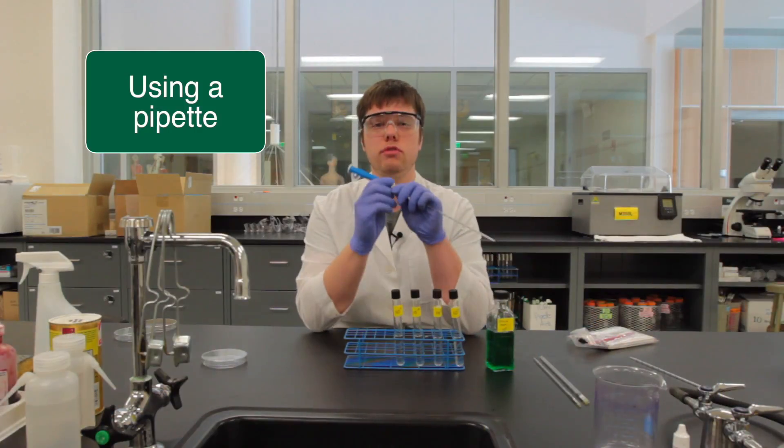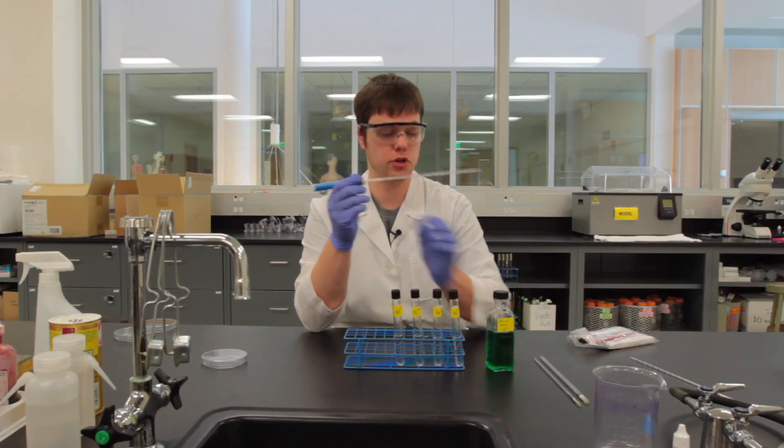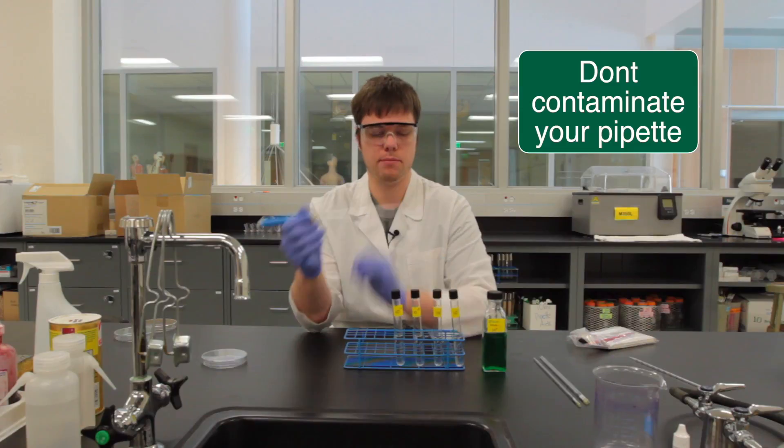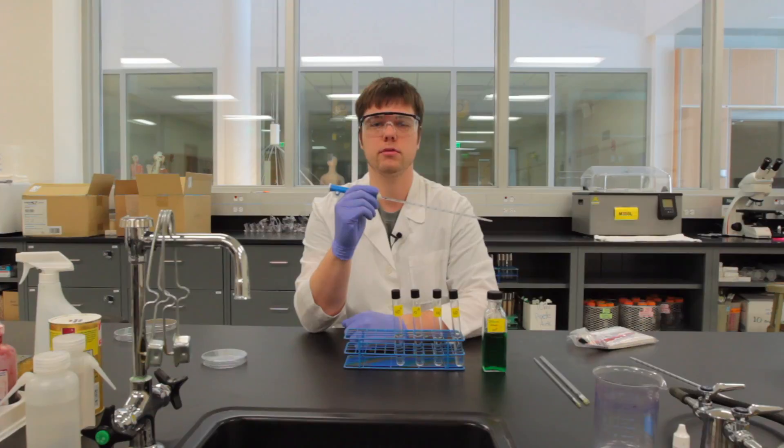We want to make sure that whenever we're using our pipettes and we're planning on putting them into a solution of bacteria, for example, that we don't let that pipette touch the table because that's going to throw off our counts and we want to be as accurate as possible.